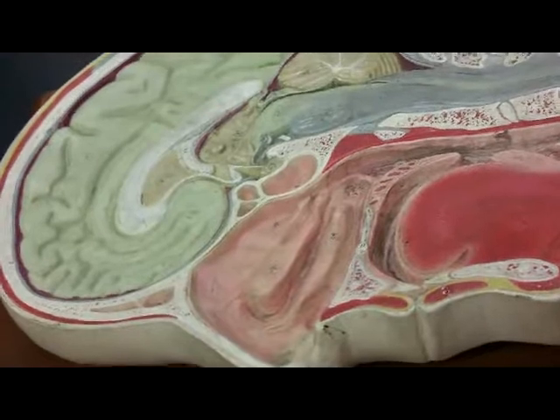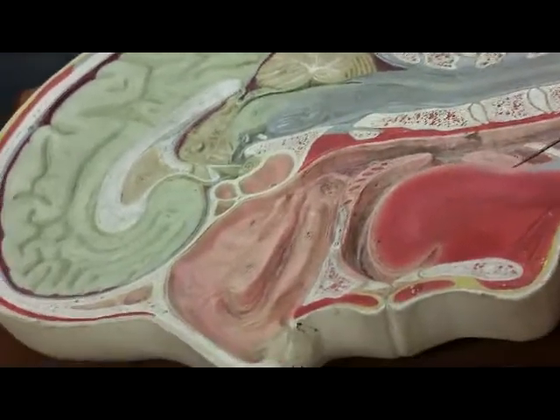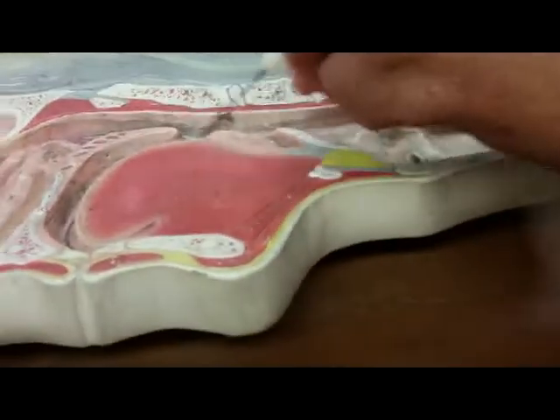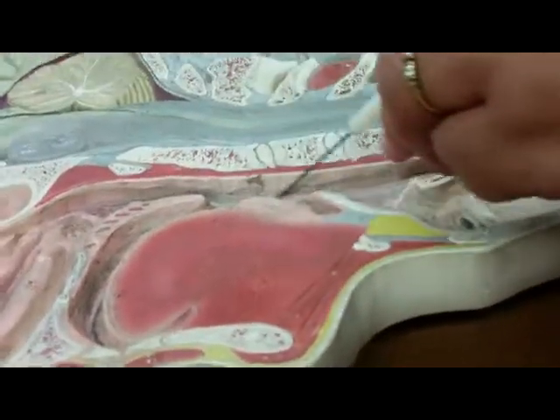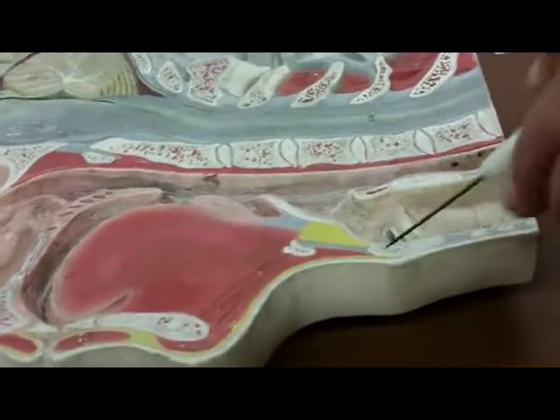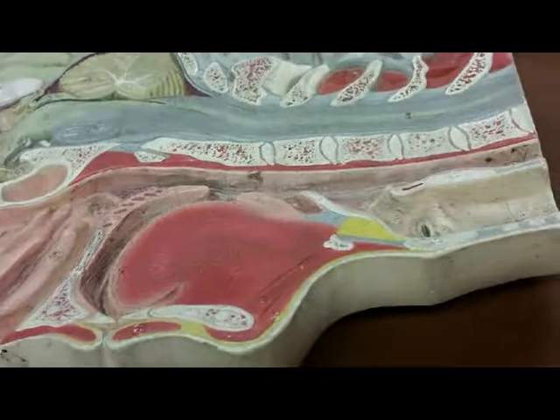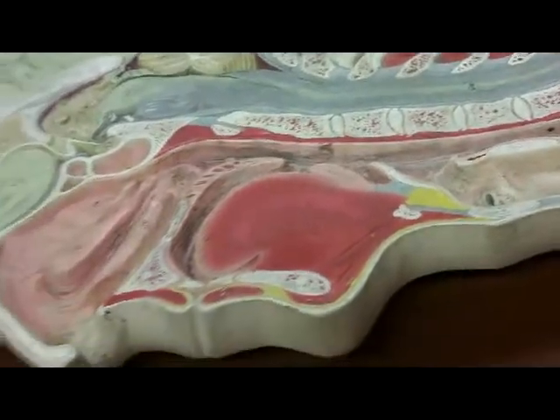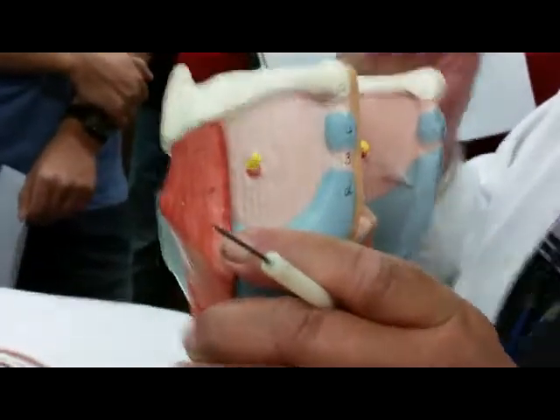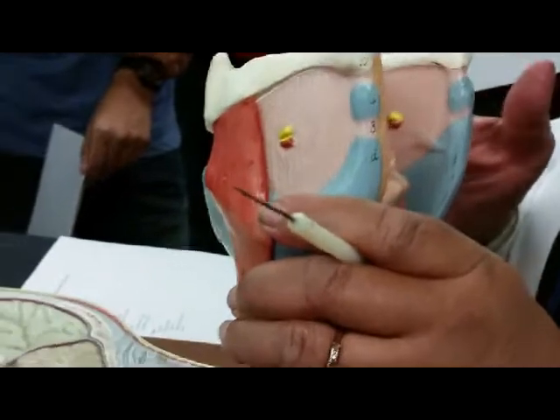So now we go back to the respiratory system. The tube in the throat, that is the pharynx. And then we move now to the larynx. The larynx is down there. But we have a better way of identifying the larynx. Remember, this goes very quickly. That's the larynx. This is a hyoid bone that you studied before.